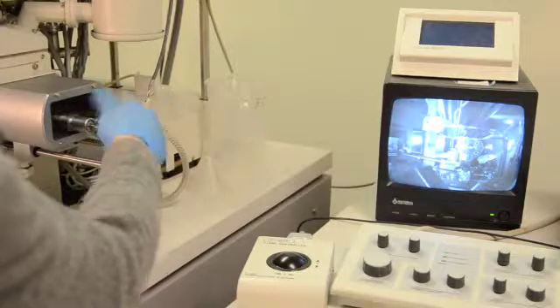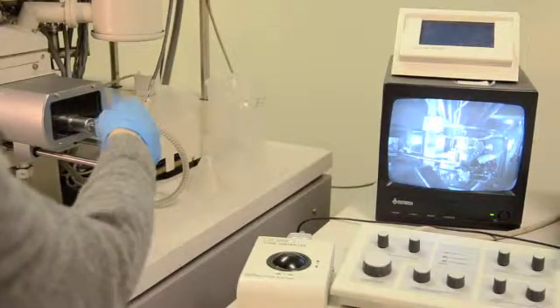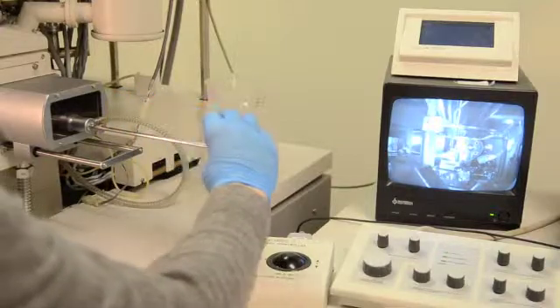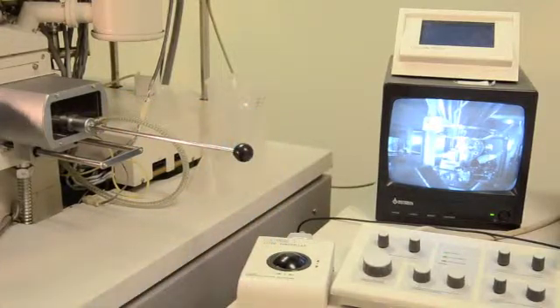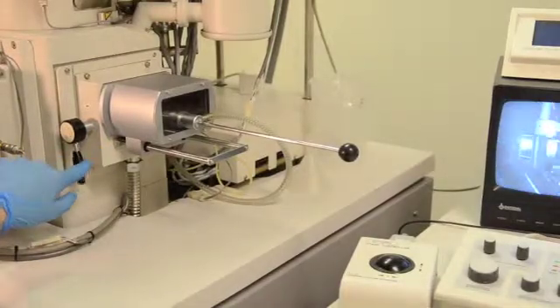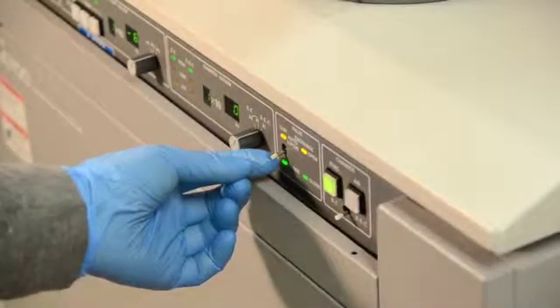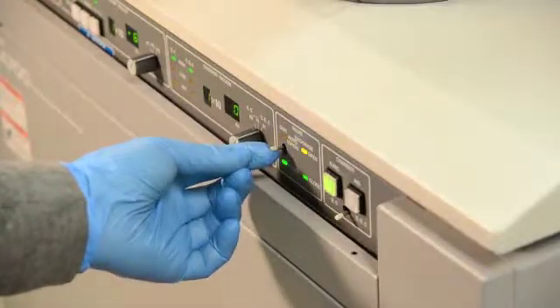Unscrew the exchange rod and pull it back into the specimen exchange chamber and lock it into resting place. Close the MV1 valve. Flip the gun valve switch from closed to auto. You are now ready to begin imaging.